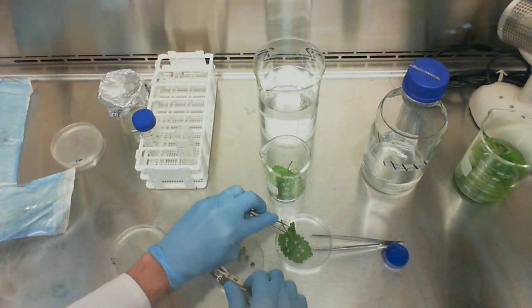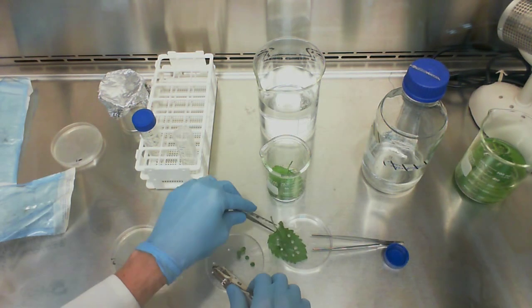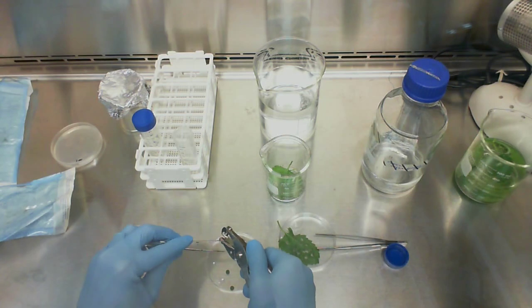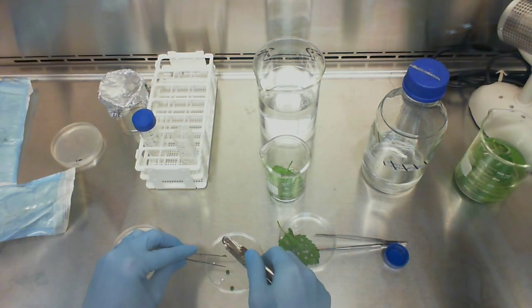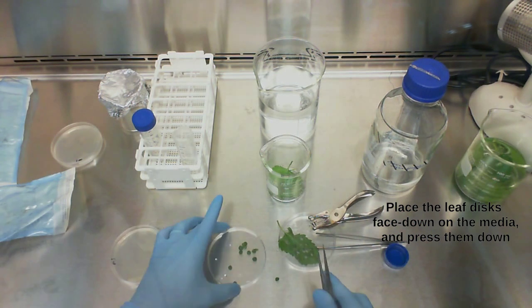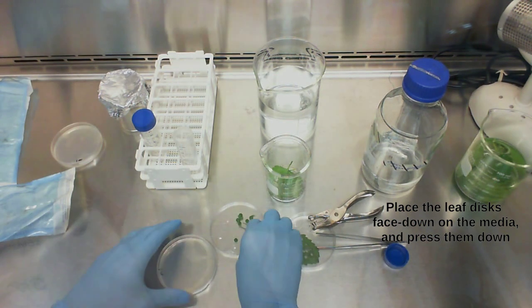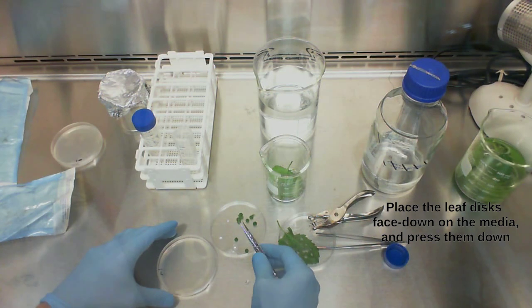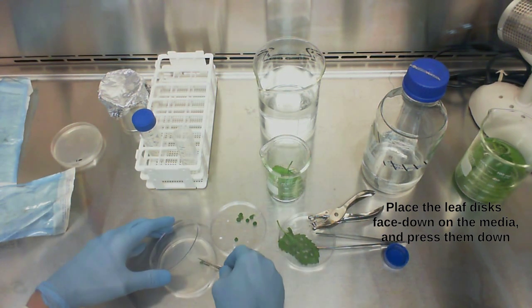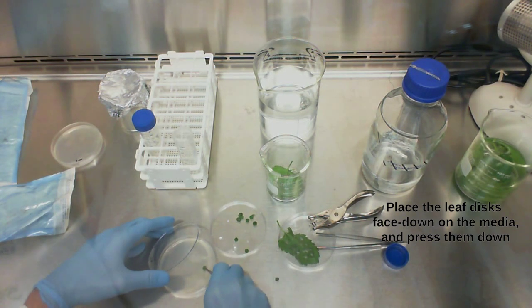I'm just going to set this aside. Now what you want to do is just put them face down. Make sure you remember where the bottom of the leaf is and set them down. Just gently press them in.